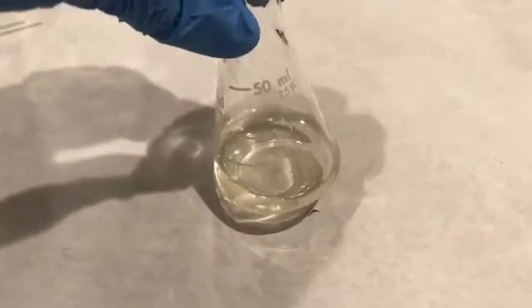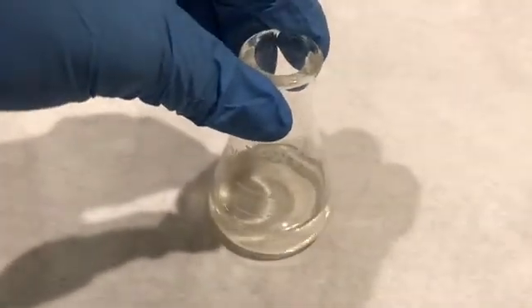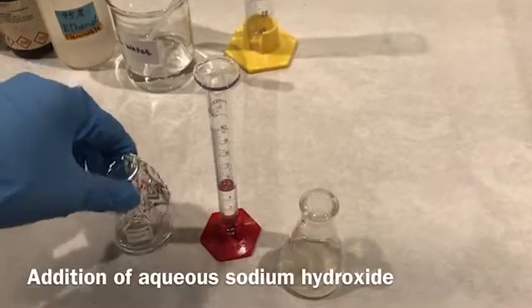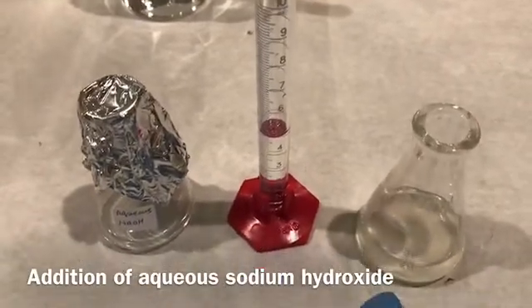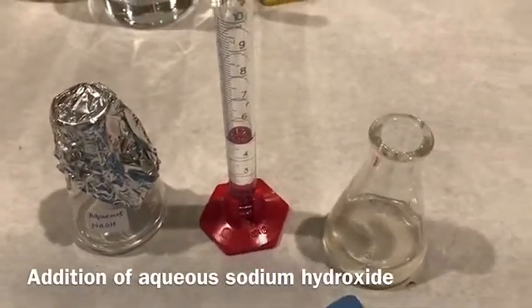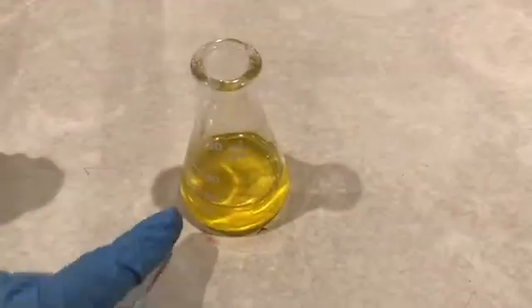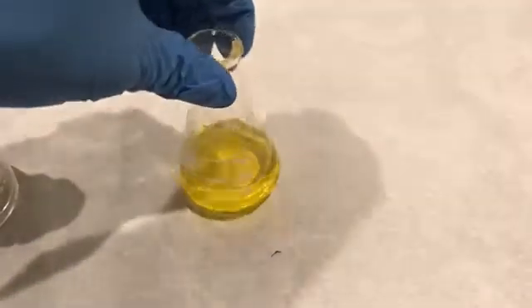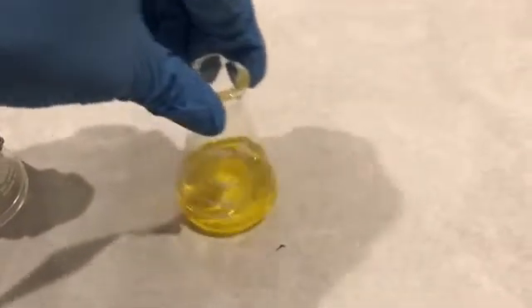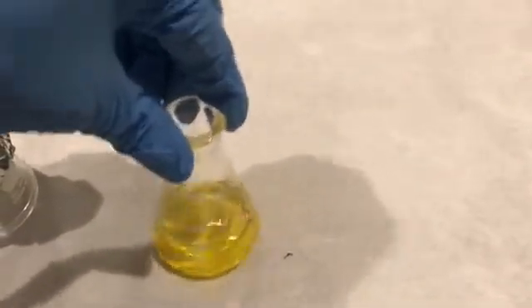To this I am going to add 4.5 milliliters of aqueous sodium hydroxide. I already measured 4.5 milliliters and I am transferring it into the Erlenmeyer flask which has the mixture of thiamine hydrochloride, ethanol, and water. You can see the color — it is a bright yellow. Now I am swirling the flask until the bright yellow turns to pale yellow. It took about two minutes of swirling to turn into the pale yellow color.